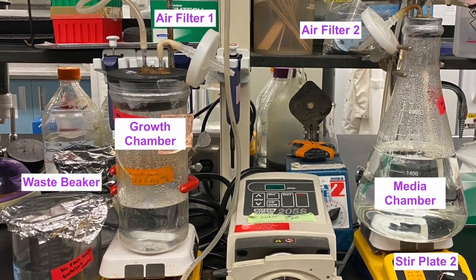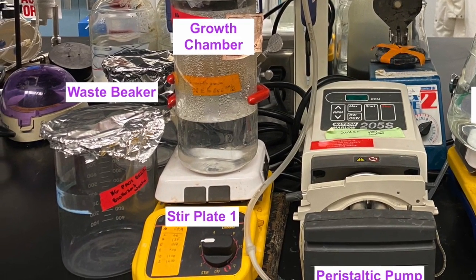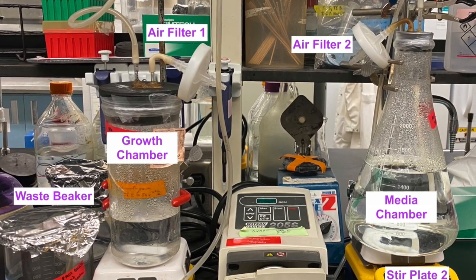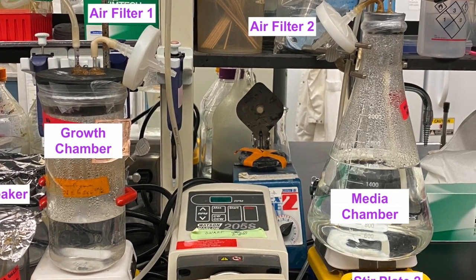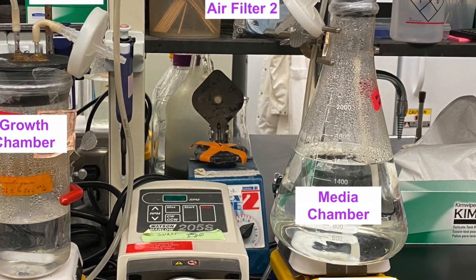The growth chamber is connected to the waste beaker, where nutrients and end-of-life products are exiting the chemostat constantly. Next, we have the media chamber, where fresh liquid media is constantly being added. Notice there is no bacterial growth in the media chamber. This is a sterile environment.